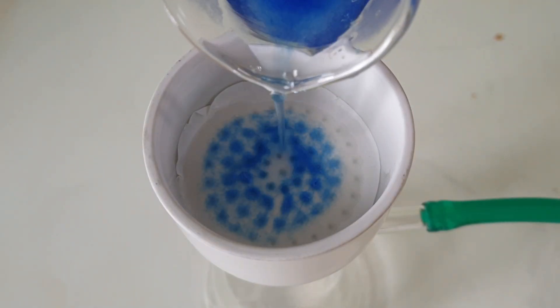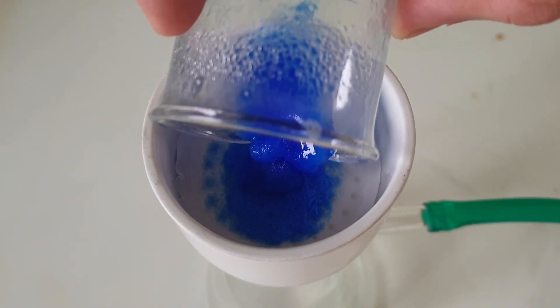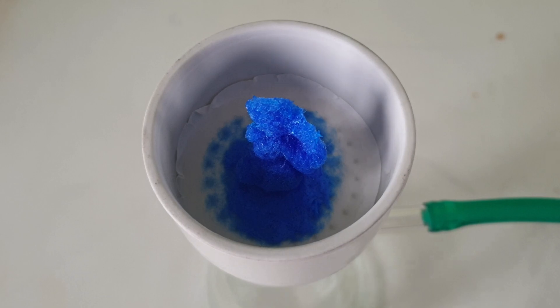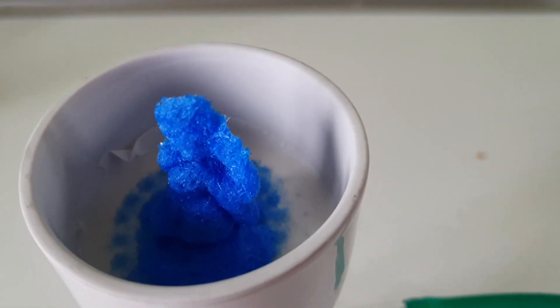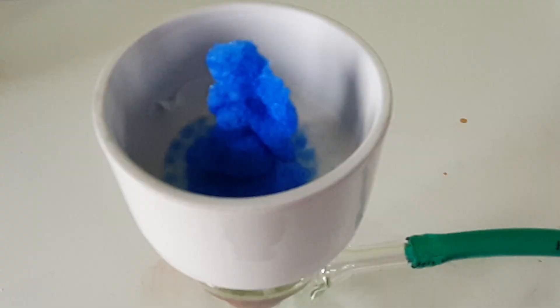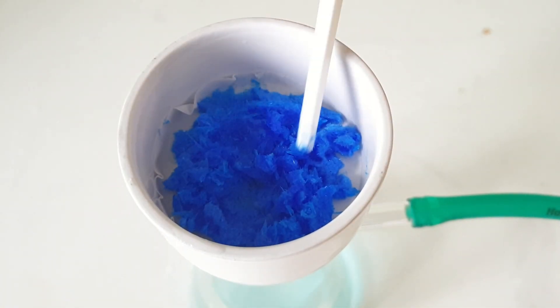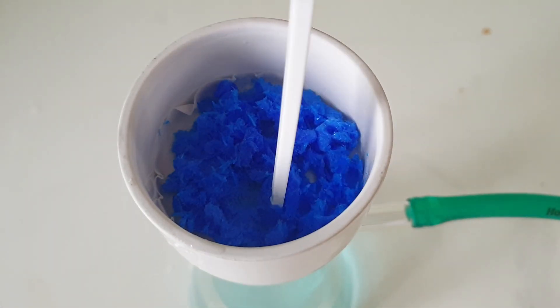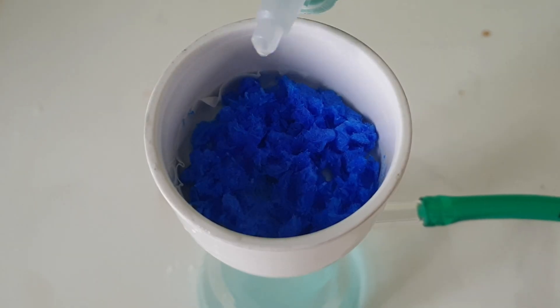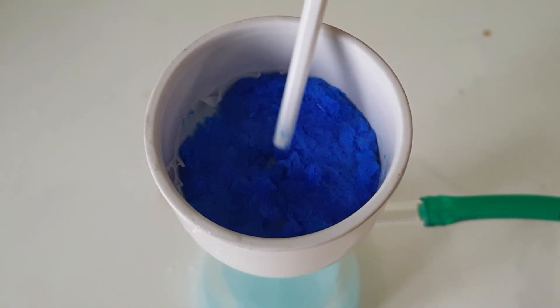After cooling to 5 degrees Celsius, I filter off the solid, which formed a funny looking crystal tower that I found quite beautiful. I then break up the big lumps of crystals and wash them with water, then ethanol and acetone to speed up the drying process.